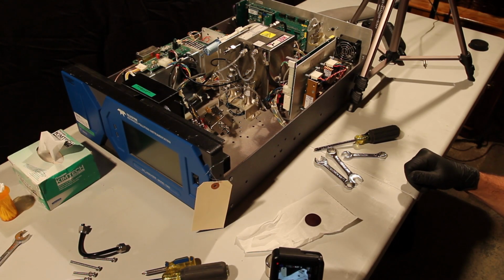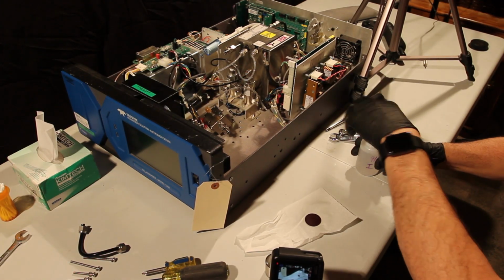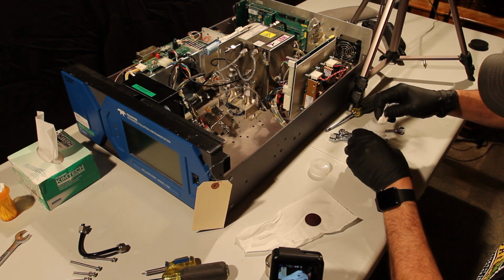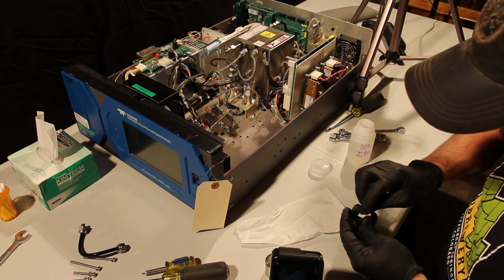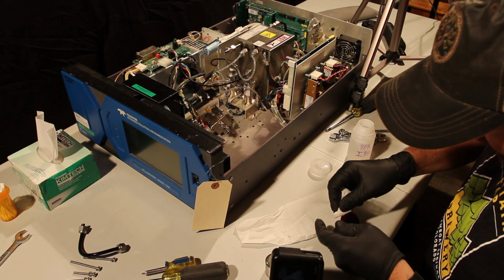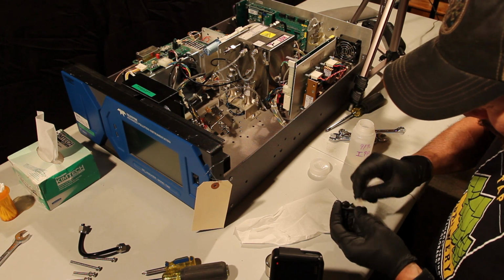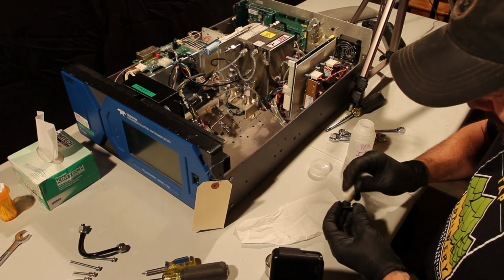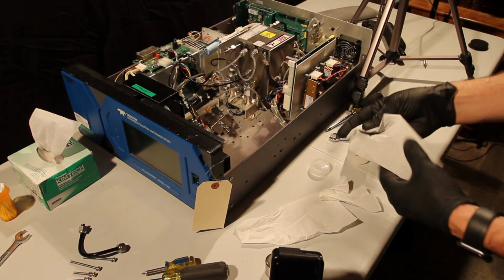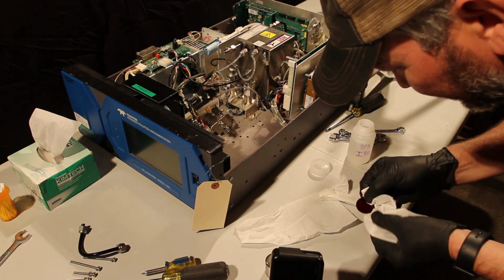Okay, so I'm going to grab another Kim wipe here and some of this 91% isopropyl. Get this little dab on there. You can clean this infrared window, get all that debris out there. You may need to do this a couple times to get it very clean. We don't want to see any residue left on there. Grab another one of these. Kim wipes work really well. They don't leave any dust behind.